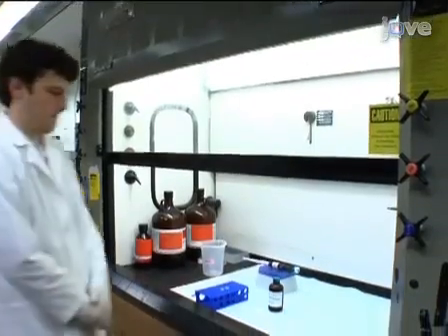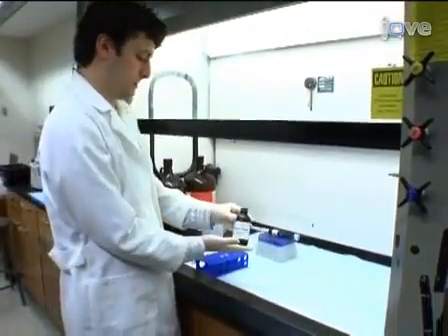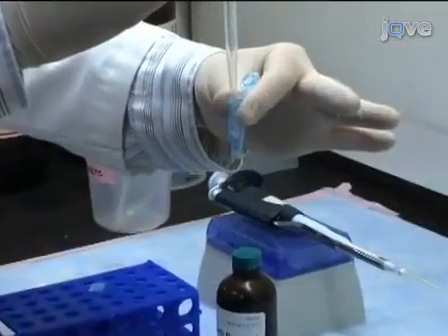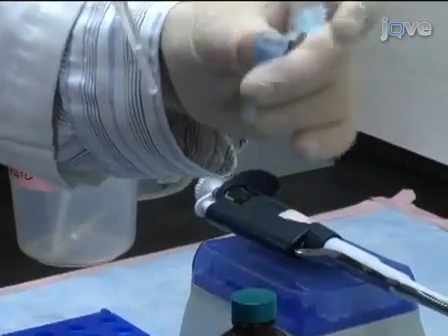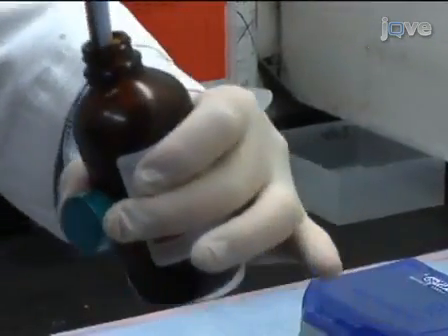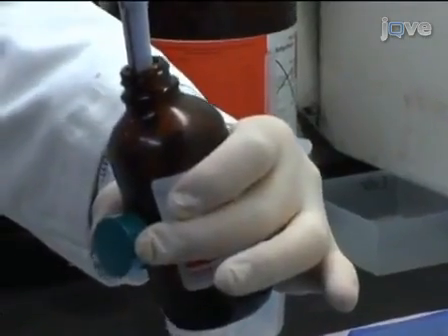To start the extraction, work in the fume hood and pool 50 zebrafish embryos in a 1.5 milliliter microfuge mortar tube. Remove as much water as possible and immediately add 250 microliters of trizol reagent which contains phenol.